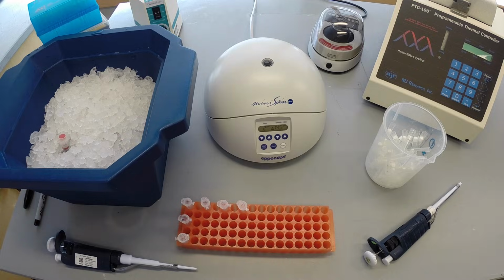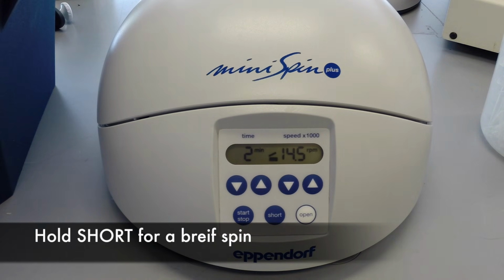Press and hold the short button to do a brief spin.